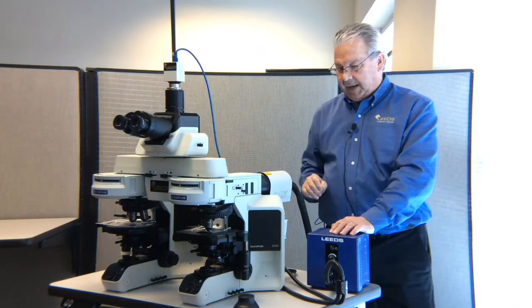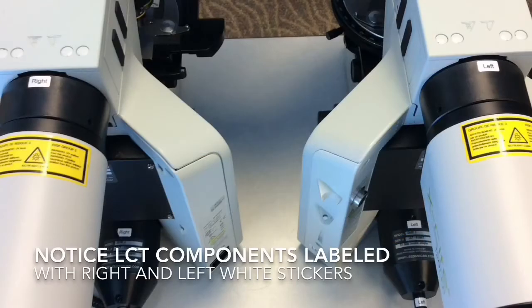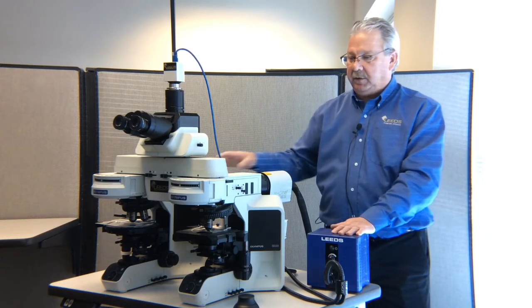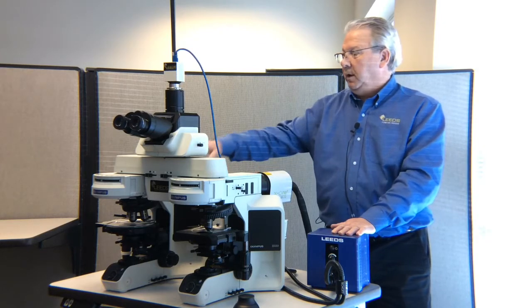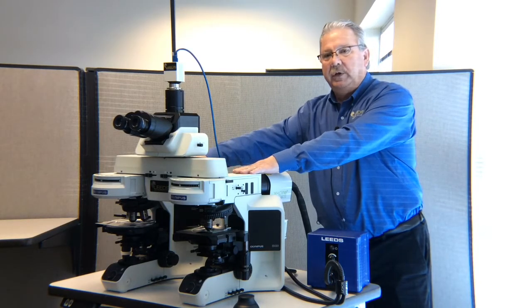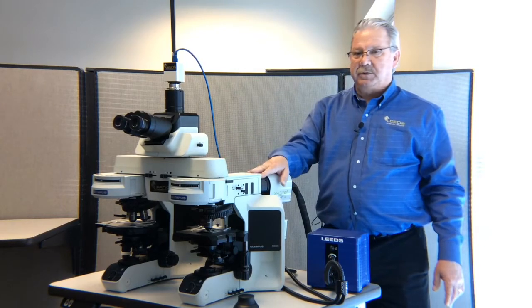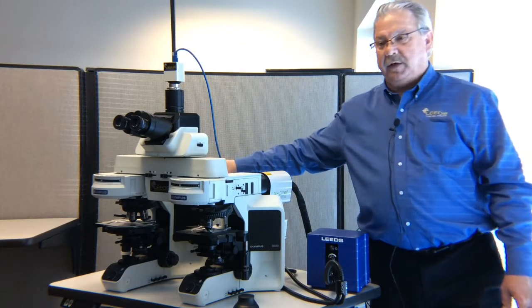When we come around to the back of the microscope, you're going to see that we have everything labeled right and left. In fact, the whole microscope is set up that way. In order to achieve proper color balance, we have had to hand sort the optics which are on the right side of the microscope and hand sort the optics that are on the left side of the microscope. By doing that, we can assure that we are able to achieve the color balance that's so important to you, and to maintain the integrity of that balance, we've got to keep those items that were located on the right side on the right microscope and on the left side on the left microscope.